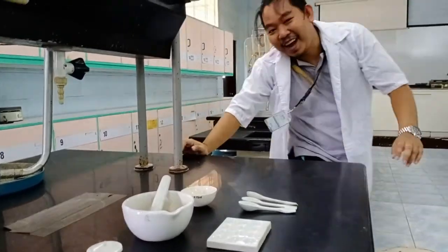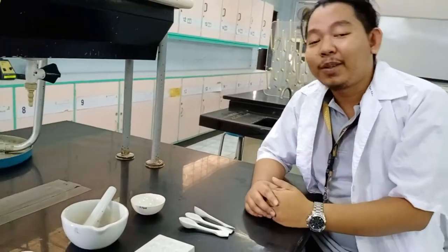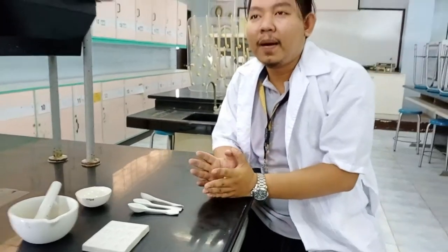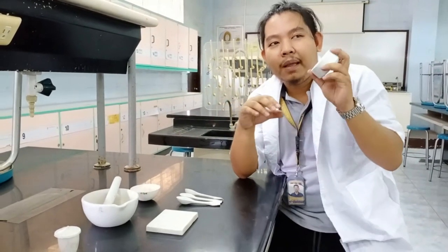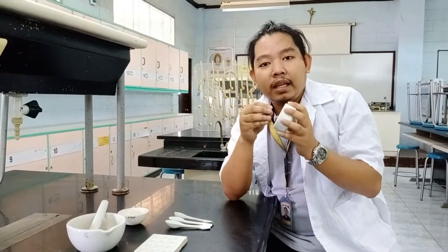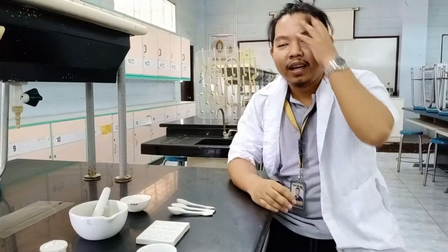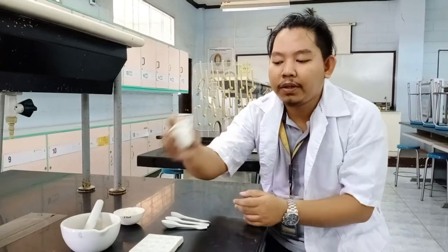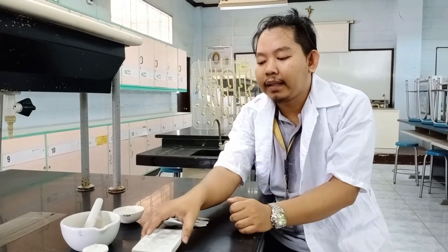Now let's proceed to our ceramics. We have a few ceramics here. And if you commented 'desiccator' a while ago for our glasswares, then you're correct — that is a desiccator. Some of these items are created in marble, some in ceramics. Let's start with this one — this is called a mortar. We also use the spot dish here, placing liquids using a dropper to observe and compare them.